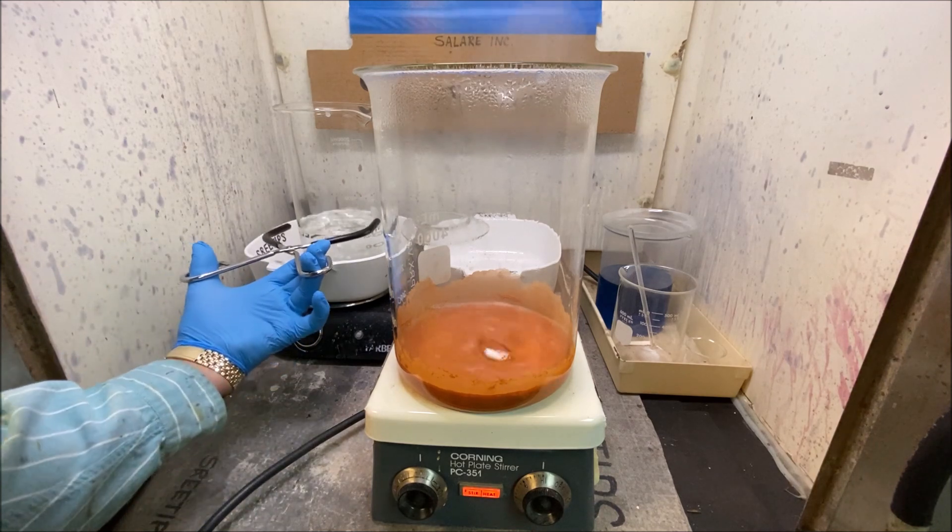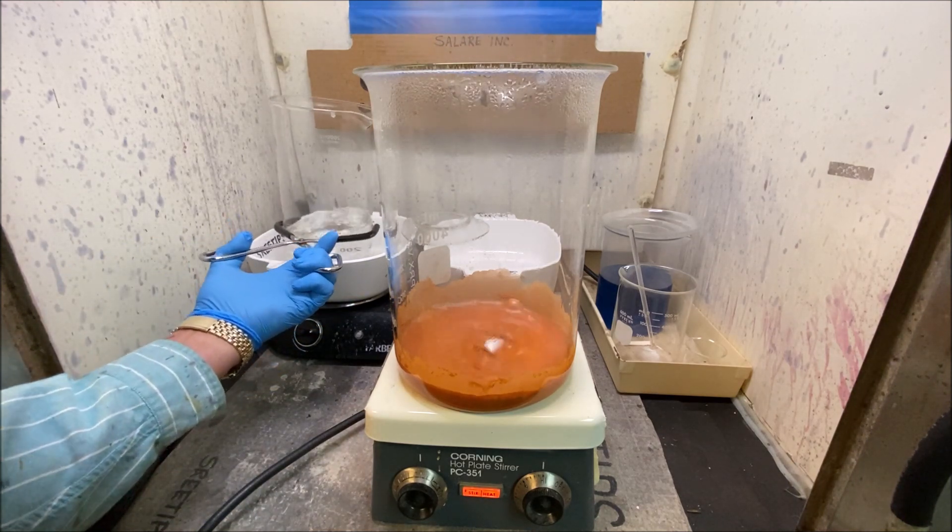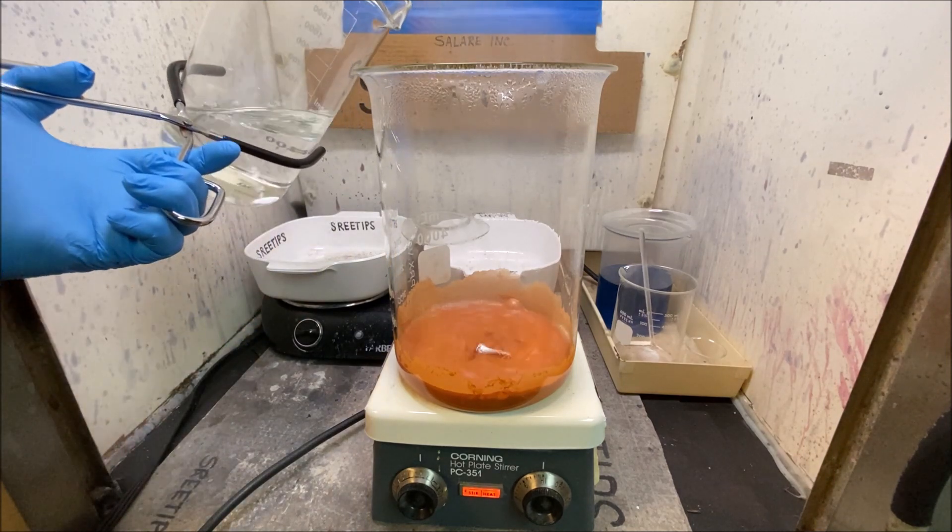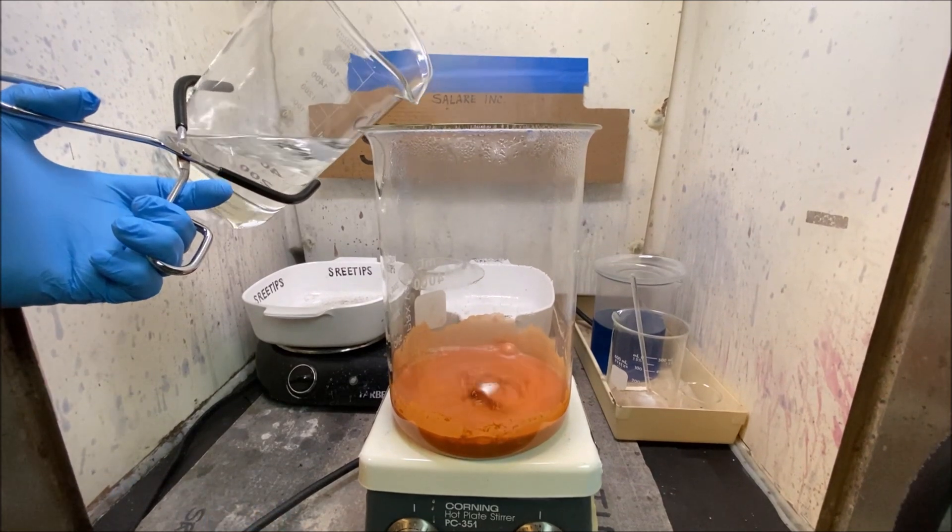All right, here we go. This got a serious freak factor going on right now because I don't know what's going to happen here. You're watching me do this for the first time.